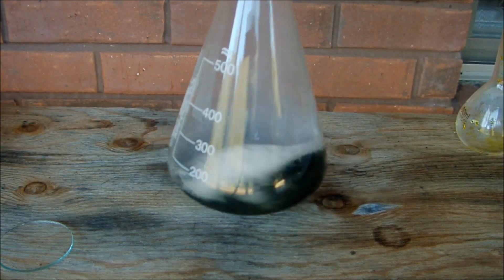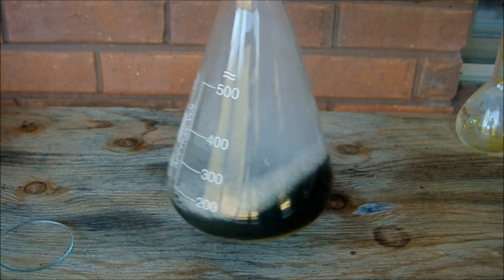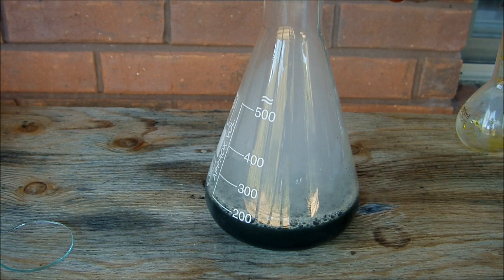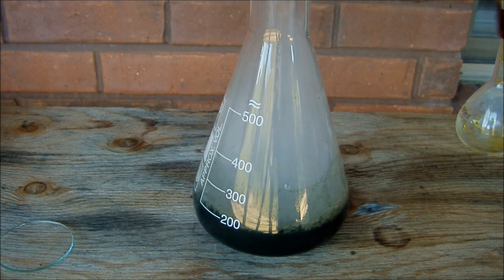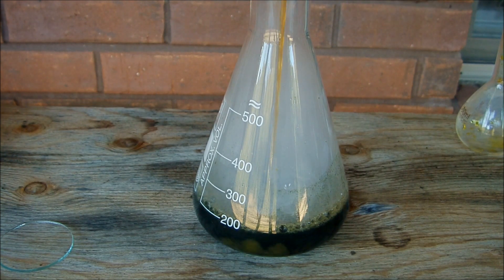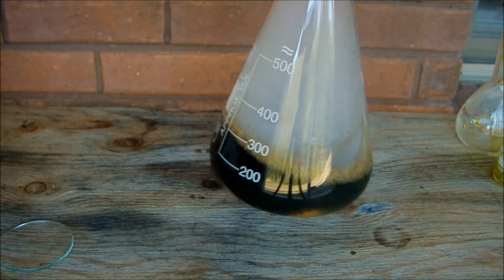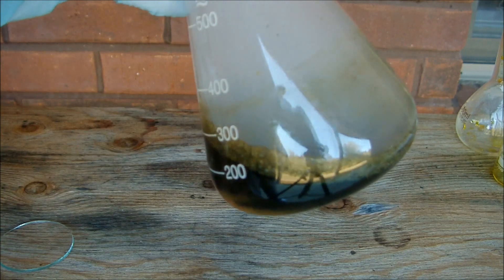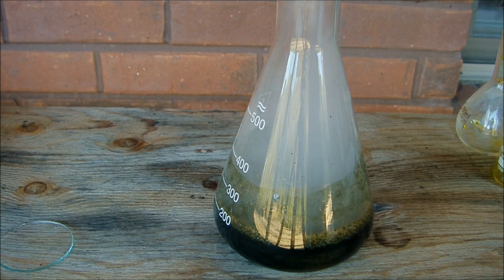You can see that generates a significant amount of heat and a good bit of steam. What this does is produce magnetite — both of the iron chlorides react with the ammonia in a complex reaction to form magnetite and ammonium chloride in solution. The magnetite precipitates out as solid particles. Now that I think about it, this steam is probably just ammonium chloride, like in my previous video where I mixed ammonia and hydrochloric acid, because there's going to be leftover hydrochloric acid in my iron chloride solutions. You can see we've got this really black precipitate of magnetite particles, which is also called black iron oxide, Fe3O4.